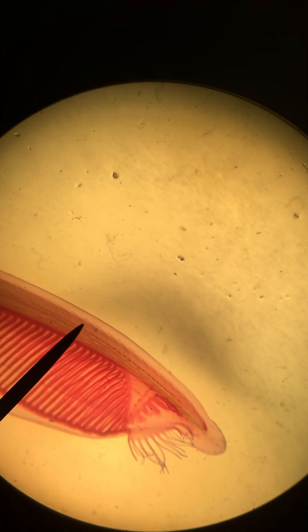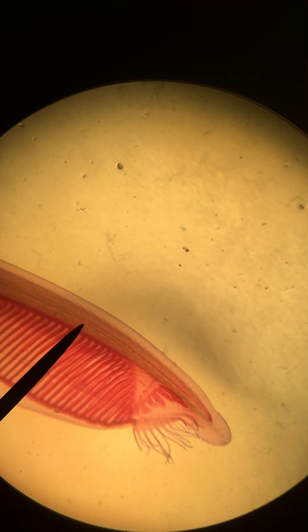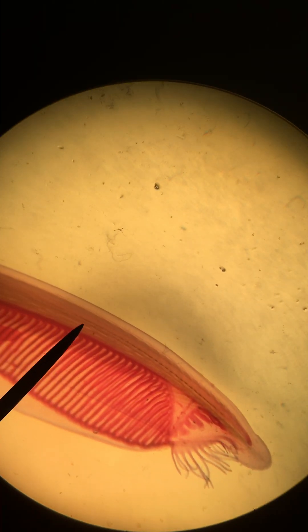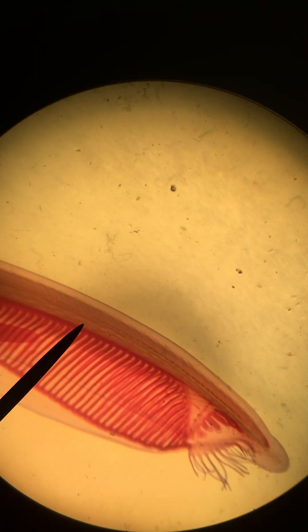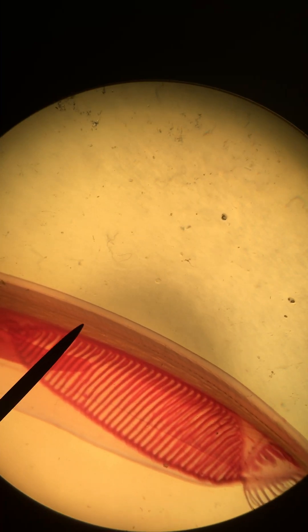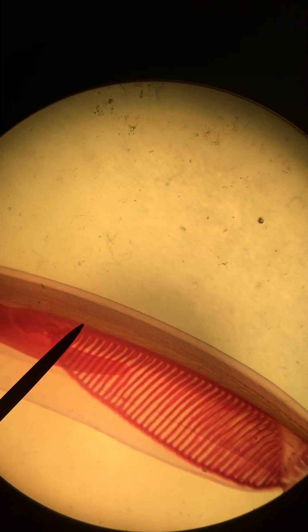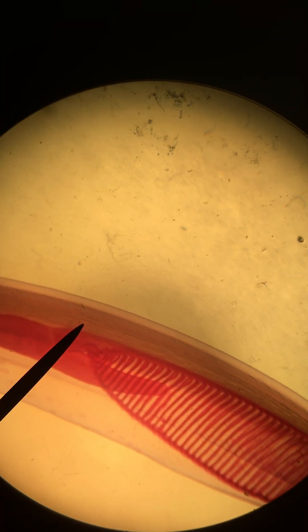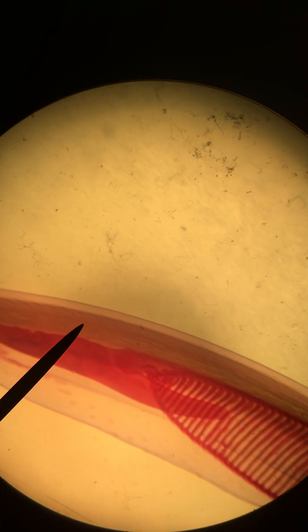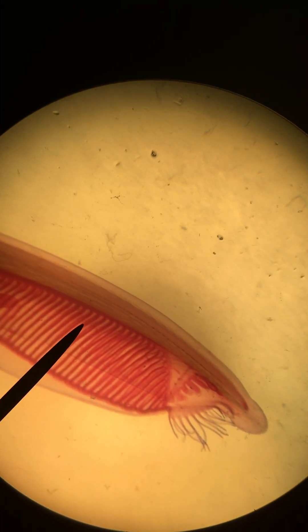Just ventral to that is the notochord, running all along the body. It's a supportive structure for the organism.